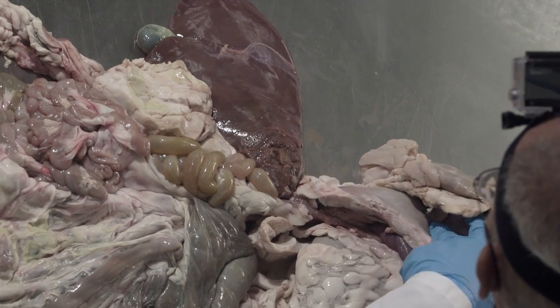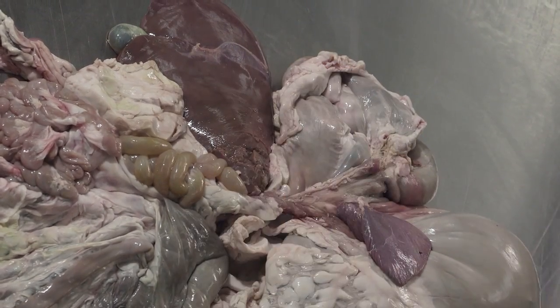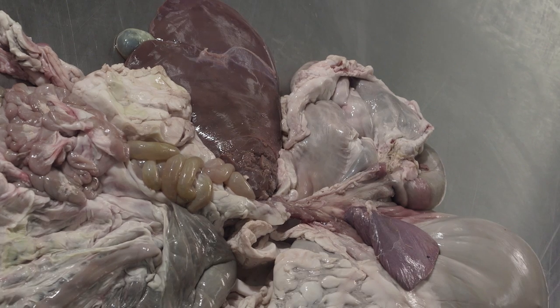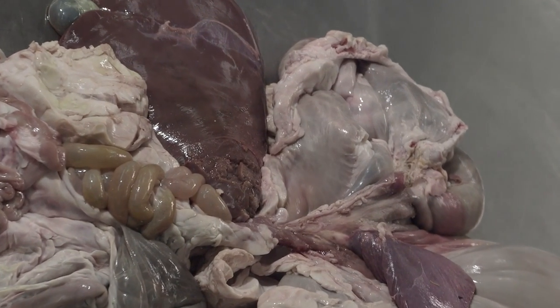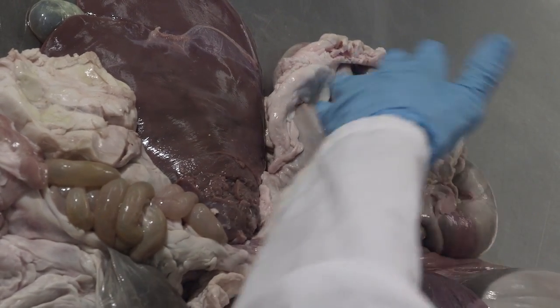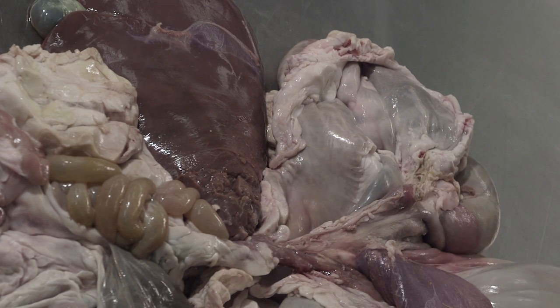This has the same function as the stomach in a monogastric animal like the pig or like us. This is where pepsin and hydrochloric acid are added and where chemical digestion of protein begins. This is also where those acids kill most of the bacteria that have moved down the tract and actually begin to digest the bacteria as well. Okay, so that's kind of a quick look at the upper end.